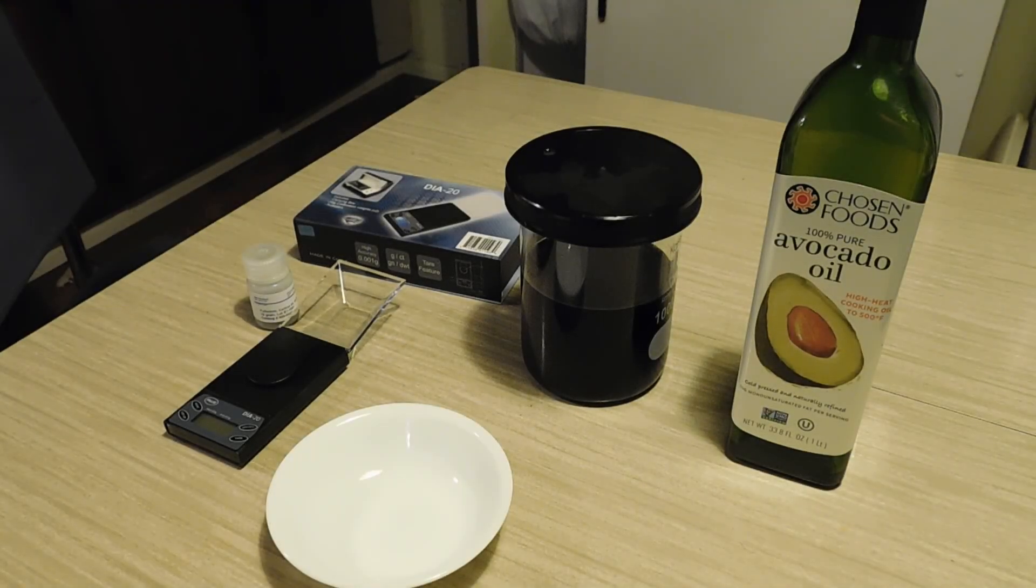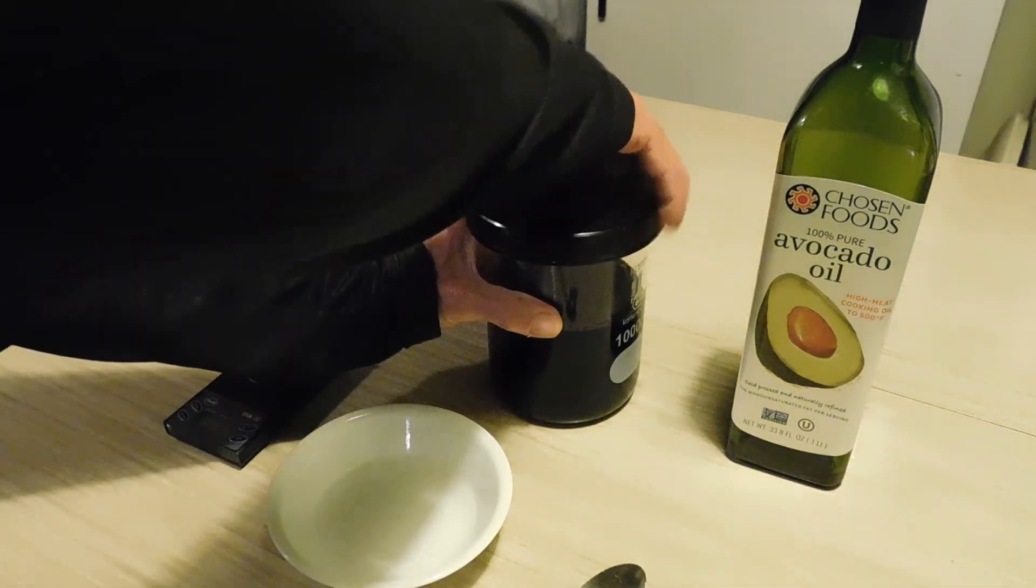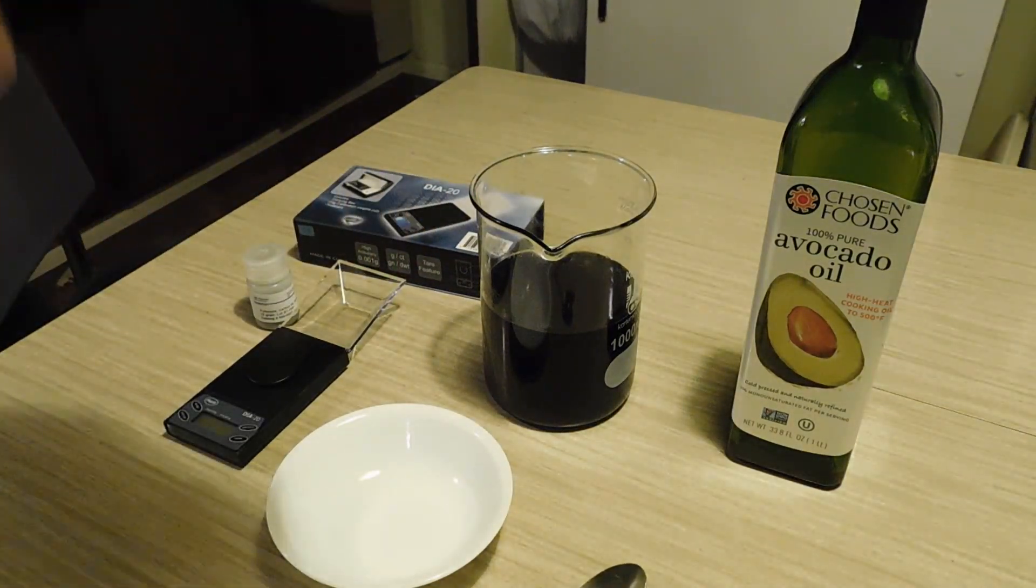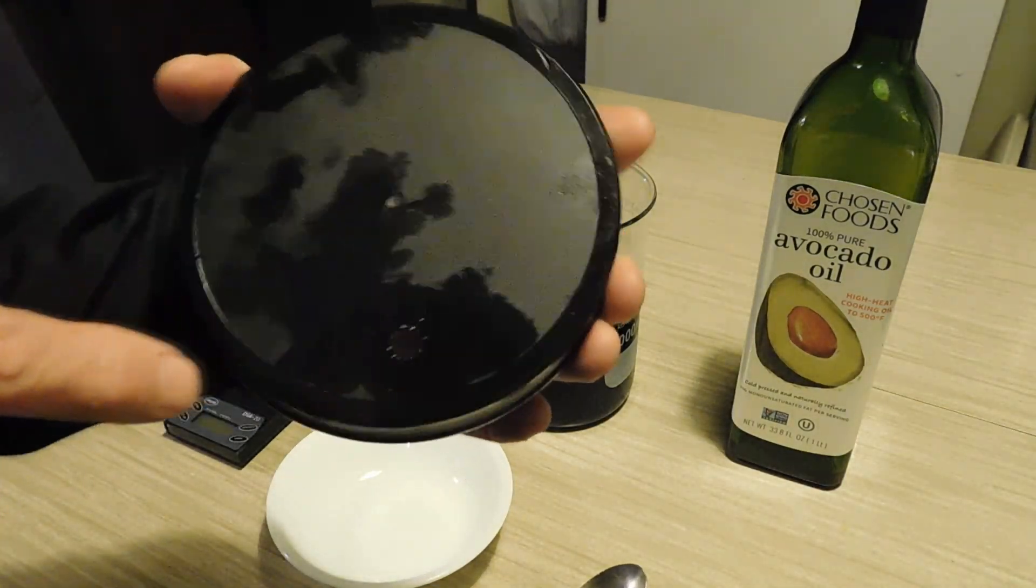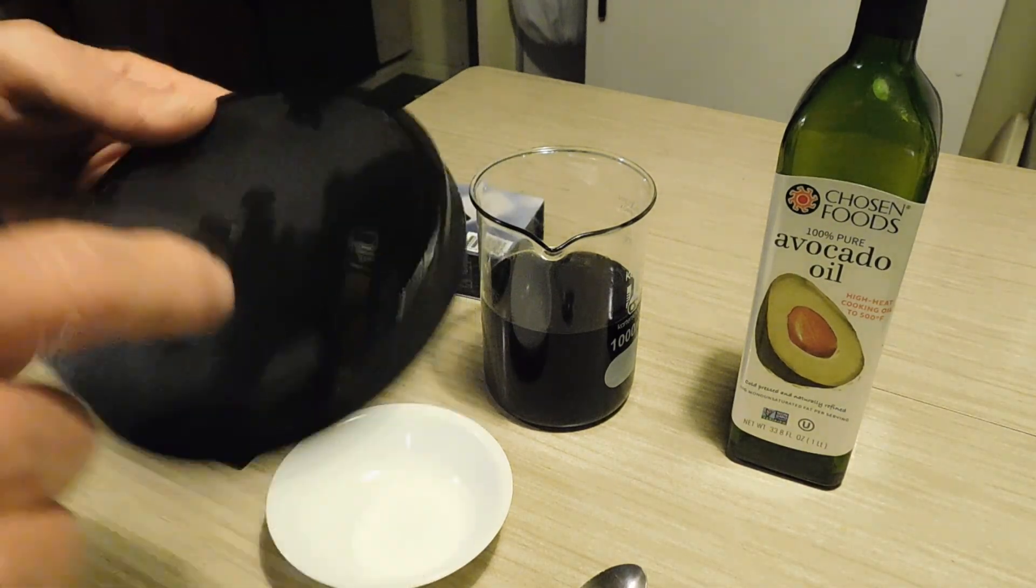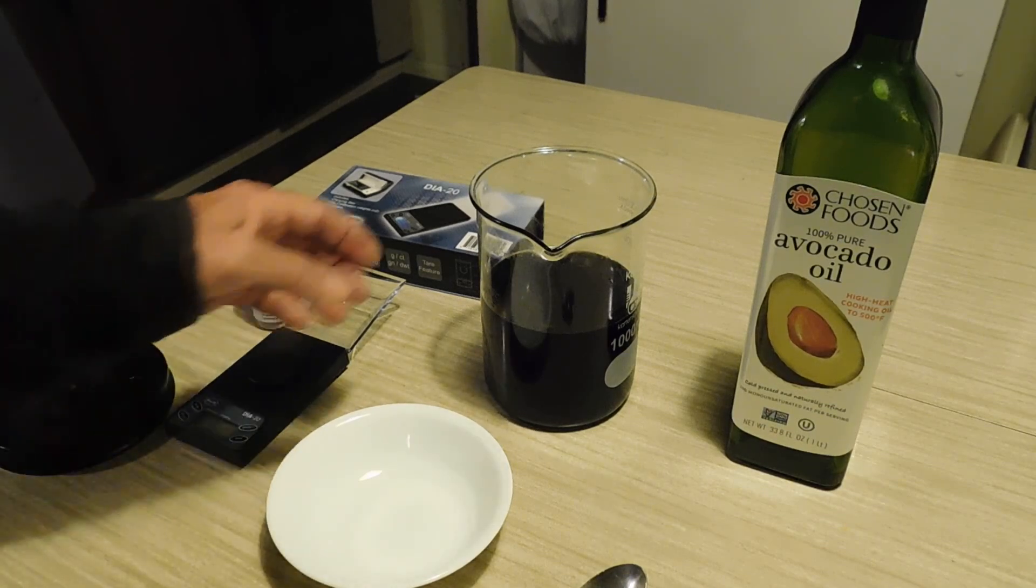Okay, we got batch oil done. And everybody's curious about why they call it, why one of the guys, Ken, calls his stuff C60 Purple Power. So, anyway, I'm going to peel off the lid here. This is a top of a jar. Got a little hole in it. You can see there, it's got a little teeny bit of oil because I've dripped on it, but you can see a little hole cut through it. And that's for the temperature probe to go in. The cover is to keep the dust out while it's stirring.